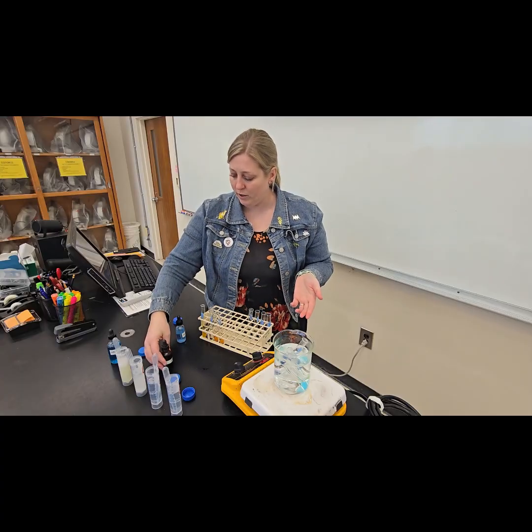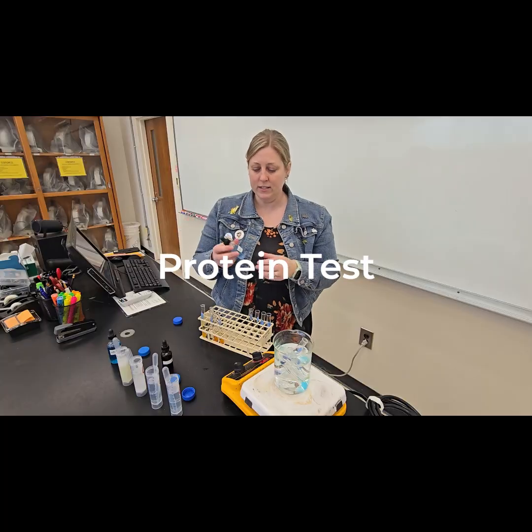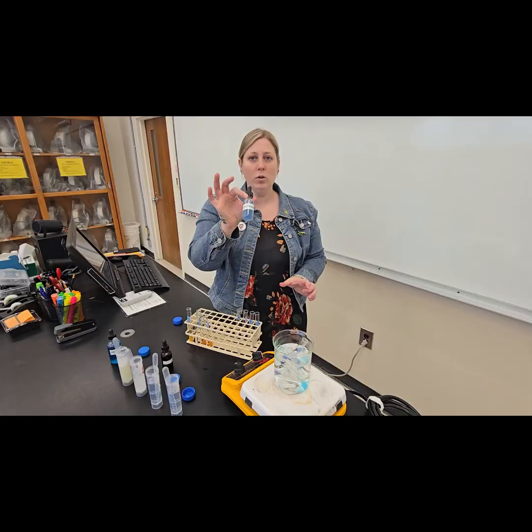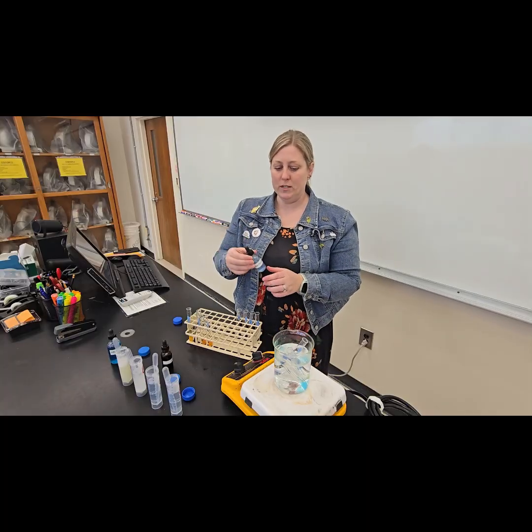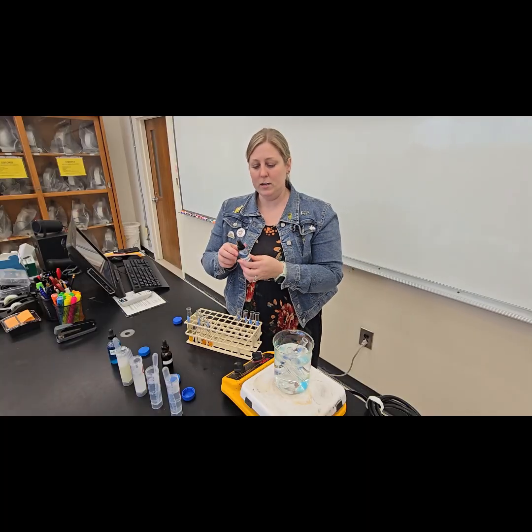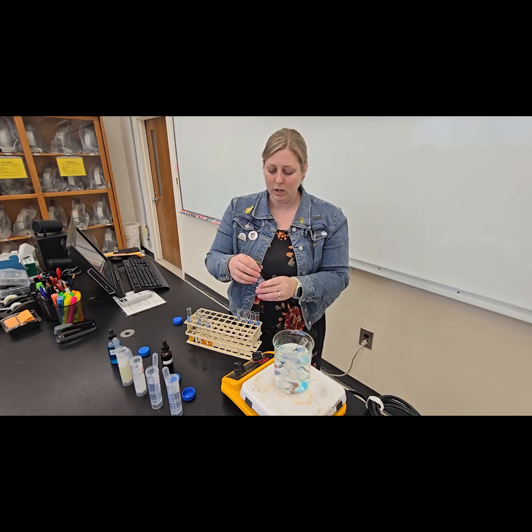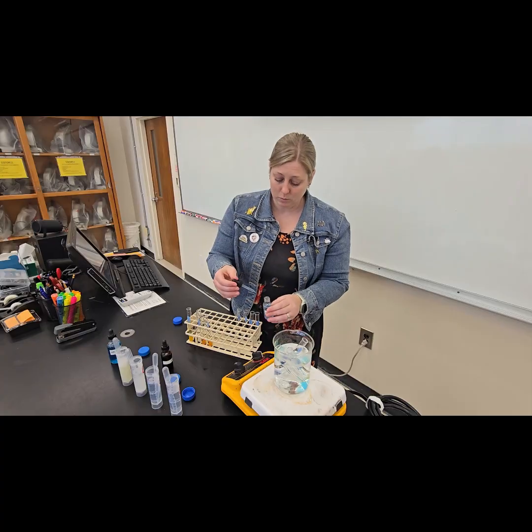The last test we're going to run is the Biuret reagent. This tests for the presence or absence of protein. So we should see no color change if there isn't any protein present, but if there is protein present, we're gonna see it turn a slight pink or purple color. So we're gonna add some to our distilled water.